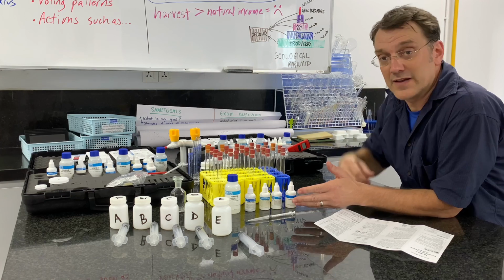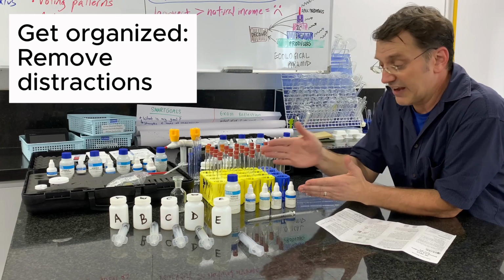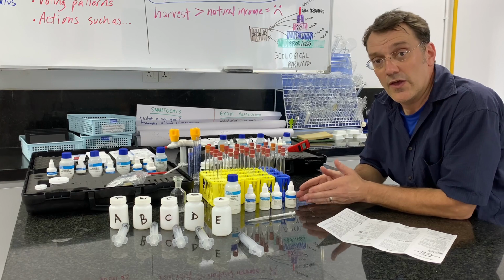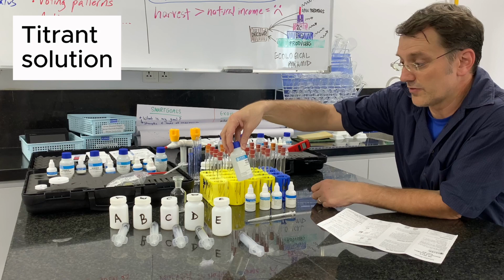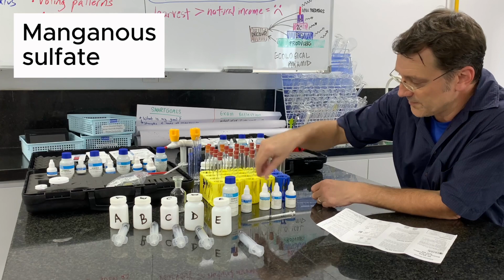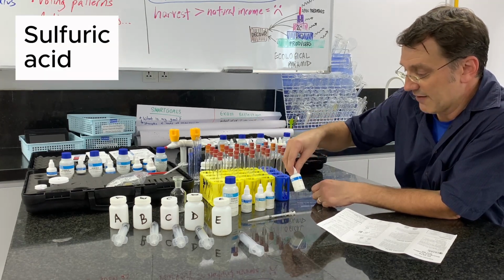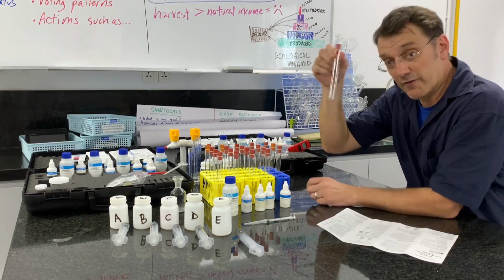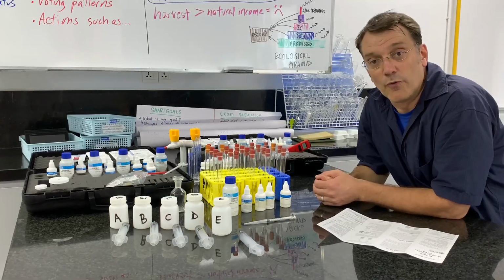There's a lot of stuff in here that I don't need for this, and it gets confusing if I've got it all sitting out. So what I've done is I've read through the instructions first, and then I've pulled out the different reagents that are needed just for this test. So here I've got the 3810 dissolved oxygen titrant solution. I have the manganese sulfate solution. I have the alkaline azide reagent. I have the sulfuric acid. I have the starch indicator. I have my little 1 milliliter syringe. And then I have a glass test tube that's clean and has an airtight stopper on top for my sample.